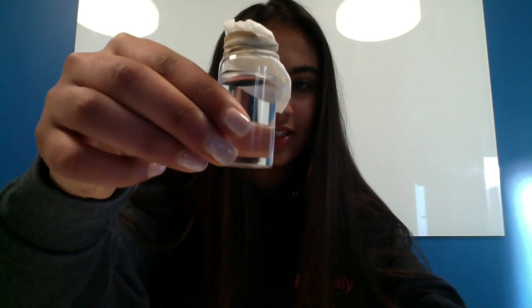Unfortunately, there hasn't been any crystal growth. I'm in the Monday lab section from 3:30 to 5:50 p.m. and they were set down on my desk at about 9 p.m. on Monday evening, and even though I've been watching them super closely for the last 4 days, there really has been no growth, which you can kind of see from here.